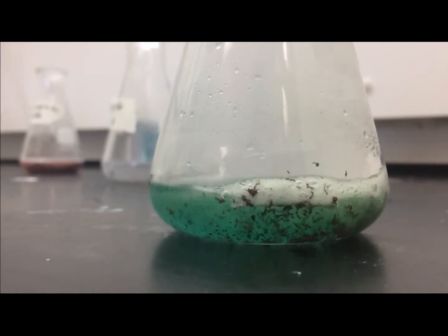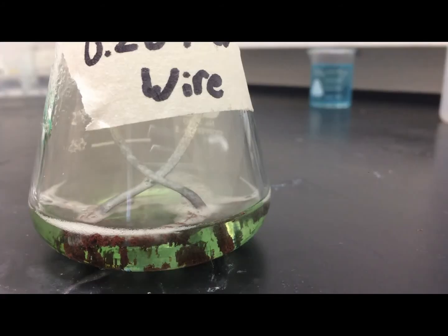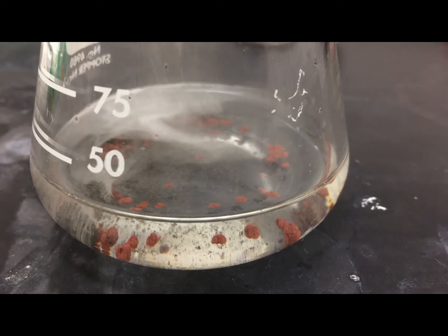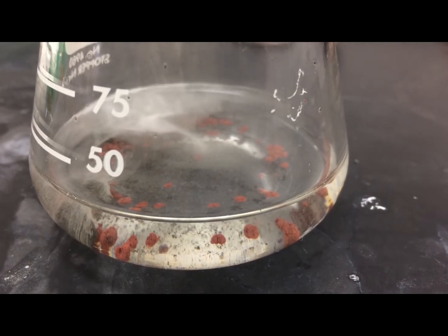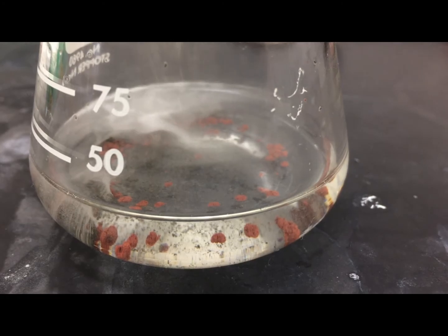0.5 grams of magnesium was added to each flask and left to settle for 5 to 10 minutes. This process resulted in a reaction which left copper at the bottom of the filtrate and the filtrate being clear. Any remaining magnesium was dissolved by hydrochloric acid because it would also not react with the copper.